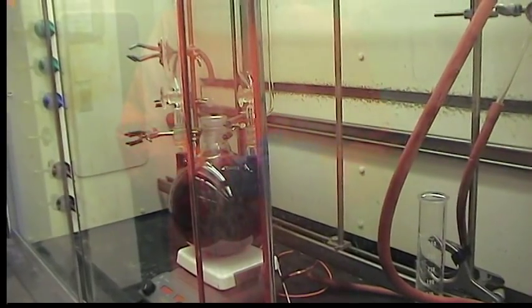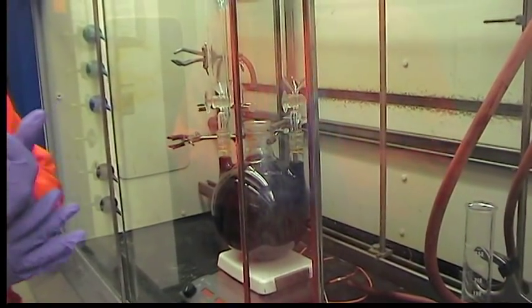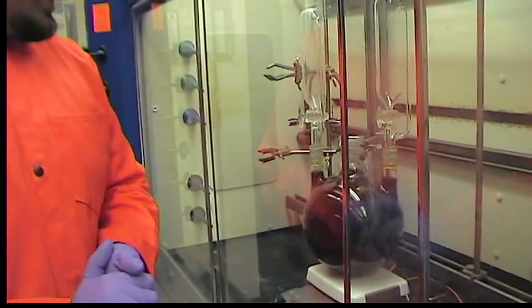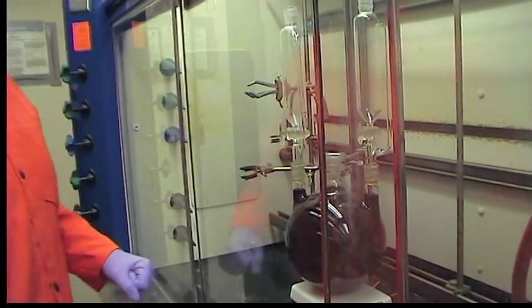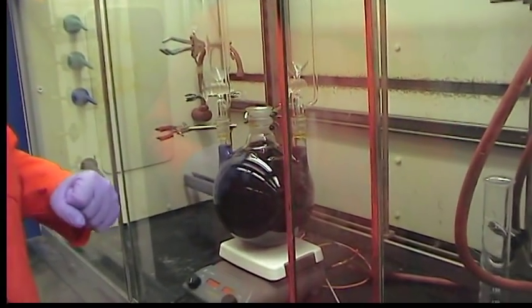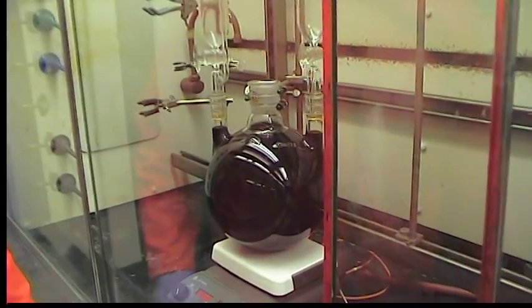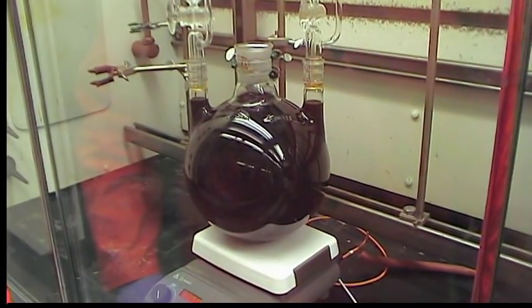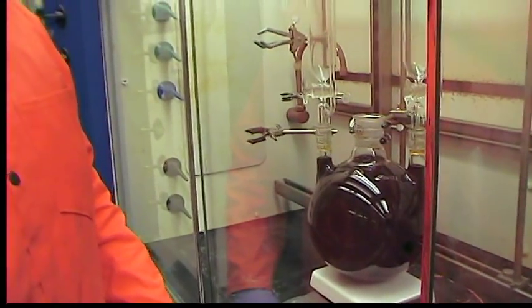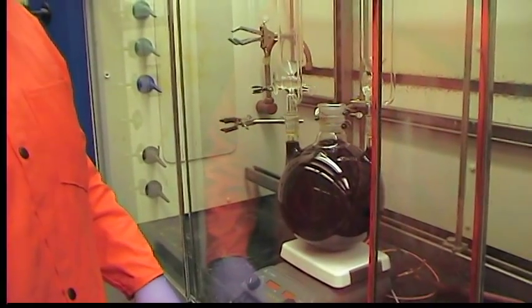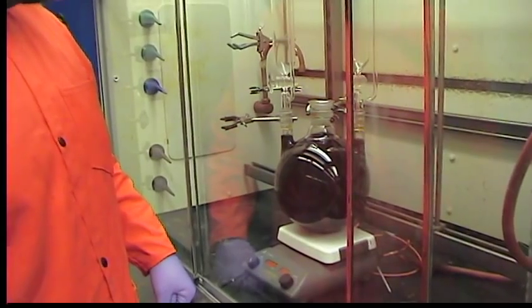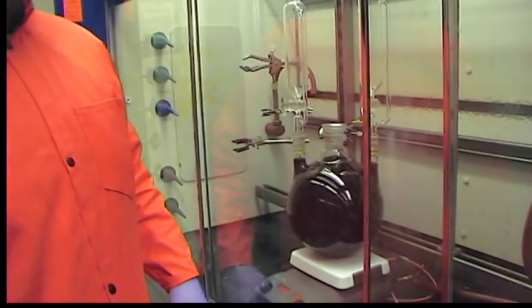The addition of the fluoroboronic acid solution has finished. It took about 2 hours. During that time the mixture warmed up, reached about 90 degrees. The color changed initially to yellow, from red, and now it's a deep brown. The solution is still warm and we're going to let it cool down slowly overnight under heavy stirring. During this time some off-white precipitate is going to crash out, and once it cools down we're going to collect that precipitate as the pyrylium salt of BF4.